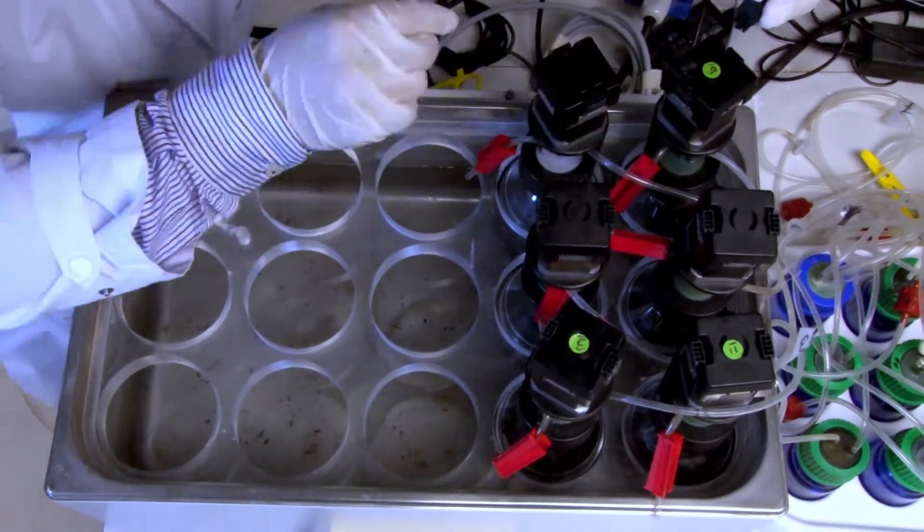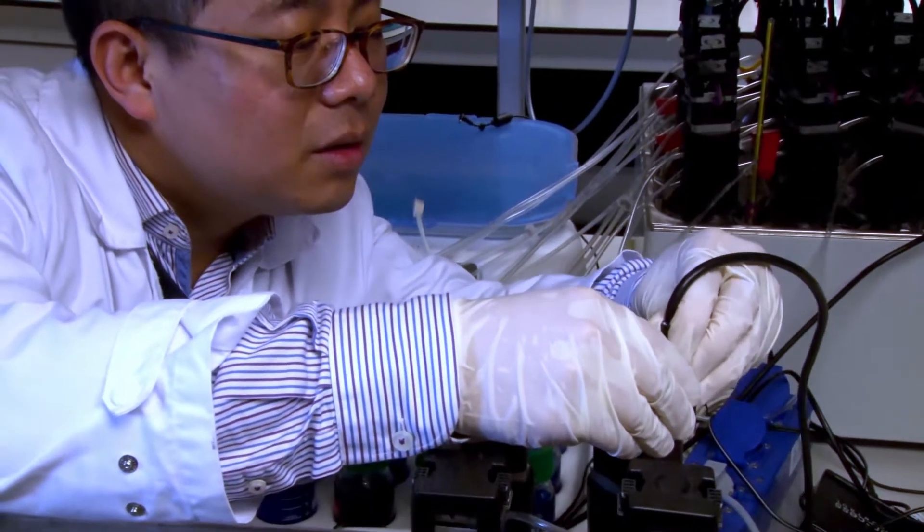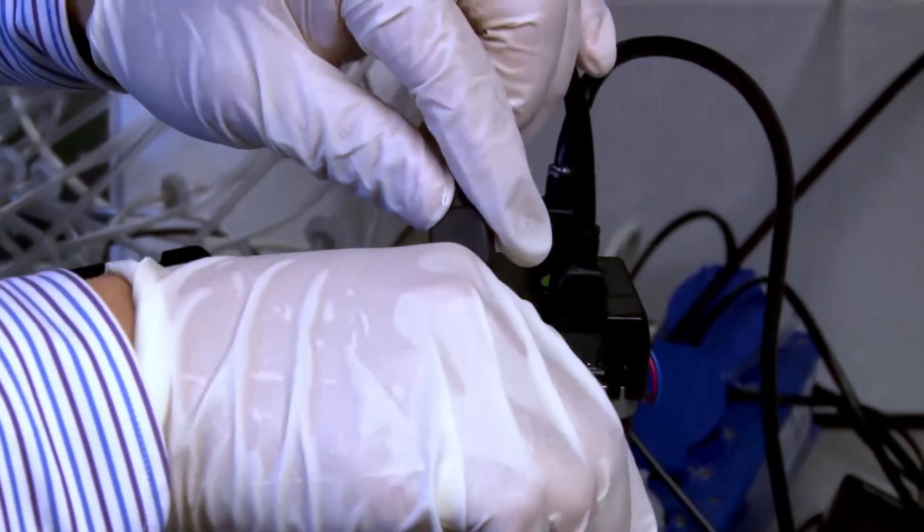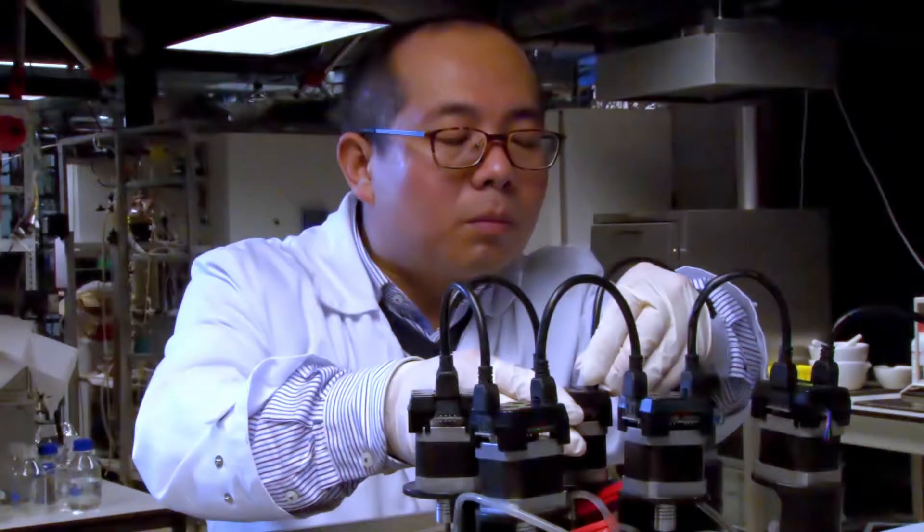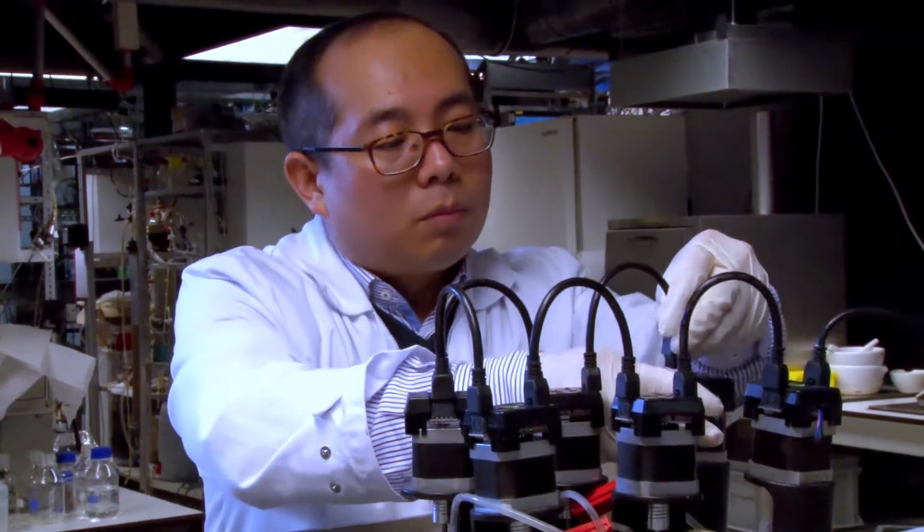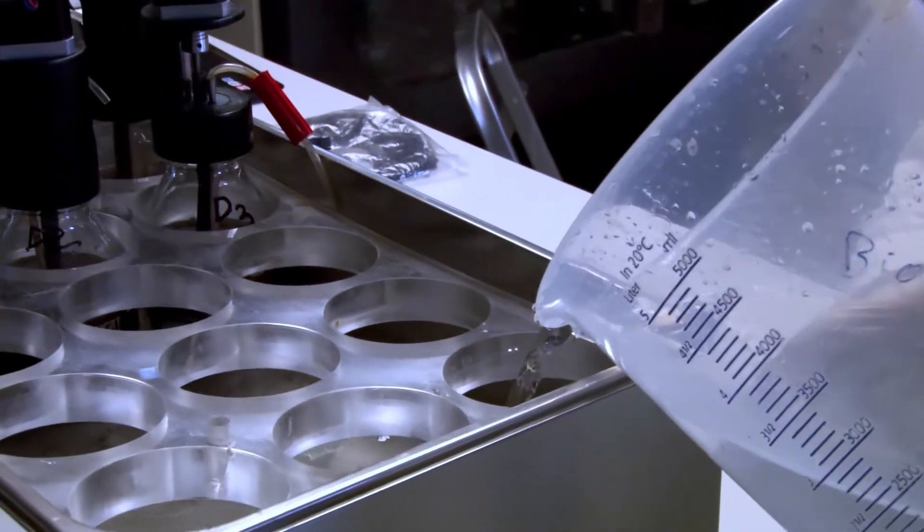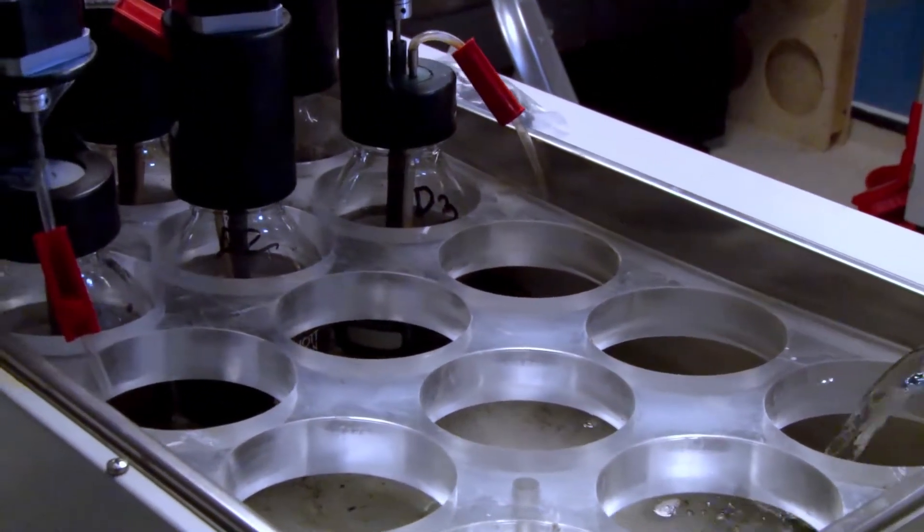Connect the motors of the bottles with the power cables. Fill up the water bath.